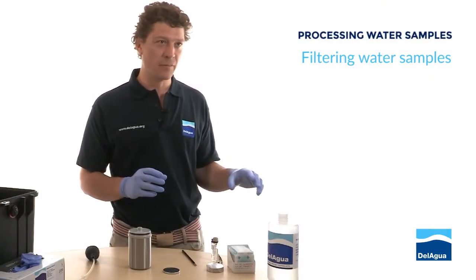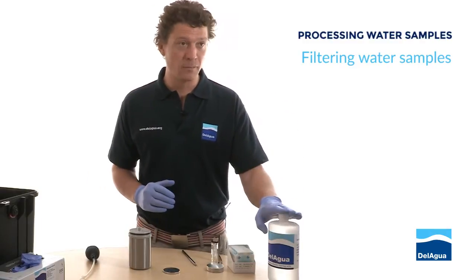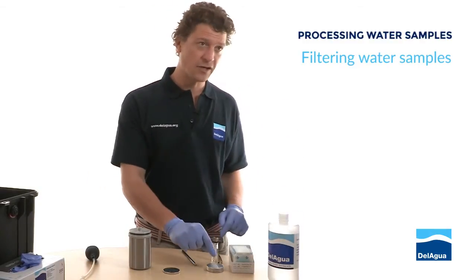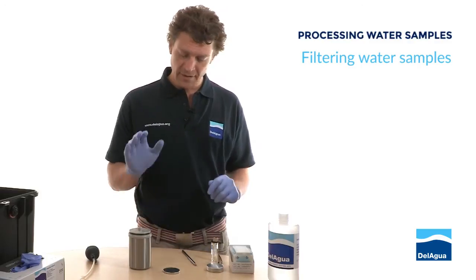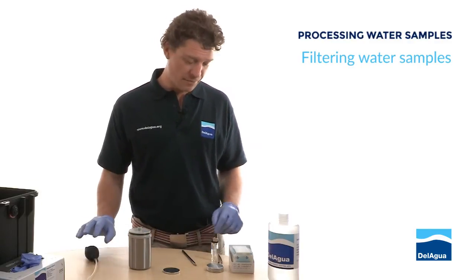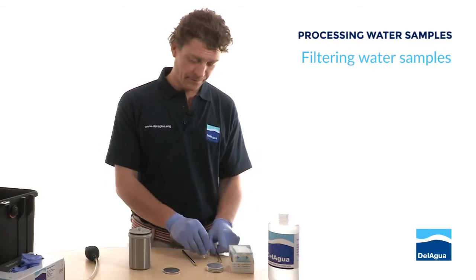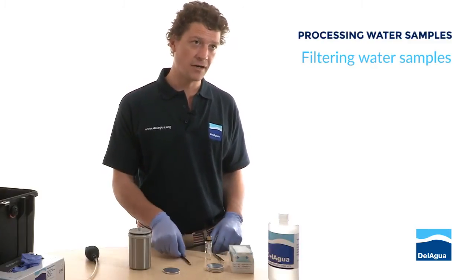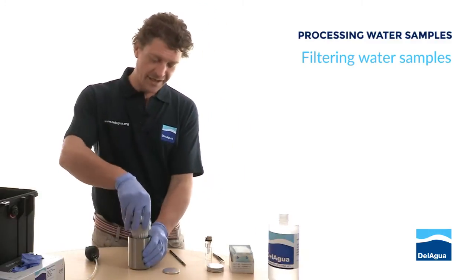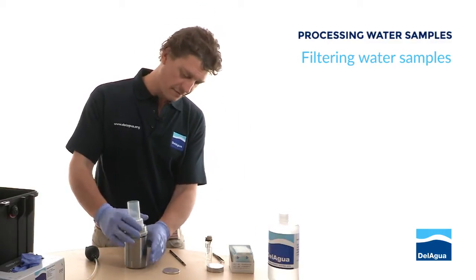Now we're ready to start processing the microbiological samples. What we'll need is our sample water, filters, petri dishes that we prepared earlier, the filtration manifold, the vacuum pump, a lighter, forceps, and a chinagraph pencil to mark up the sample after we finish processing it. The first stage is to get the filtration manifold set for filtration.